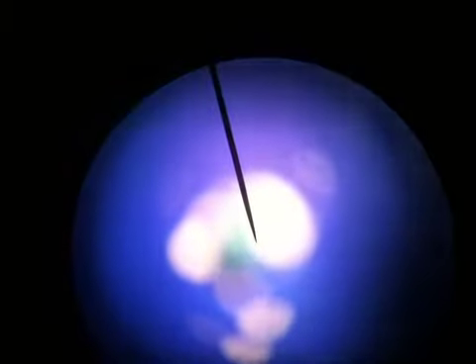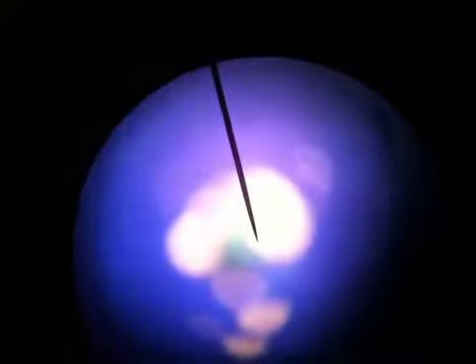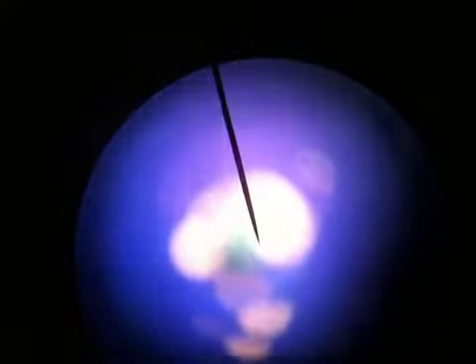Okay, so this is roughly what you see through the microscope. You don't want to hold your eye right up to the eyepiece. You hold it a little bit ways back and you'll see where the sweet spot is. So this is what you see initially with the platform all the way down. And the needle in the middle, that's just a pointer that's built into the lens.